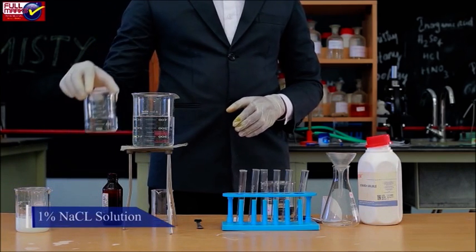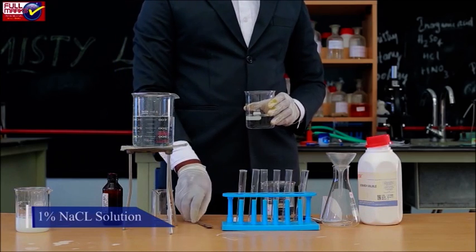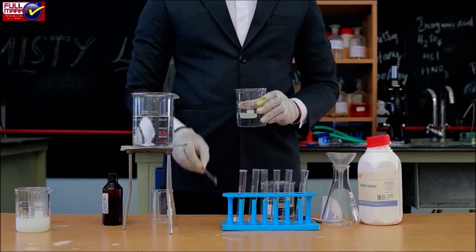1% NaCl solution: 1 gram of NaCl is to be dissolved in 100 ml of water.